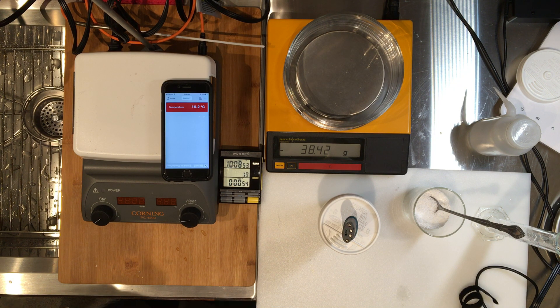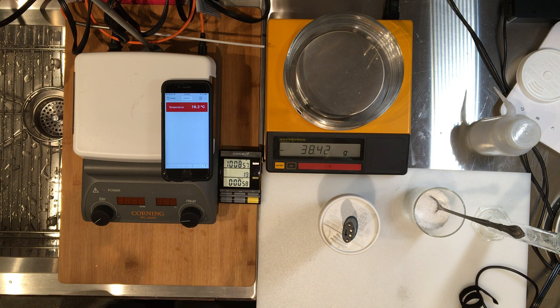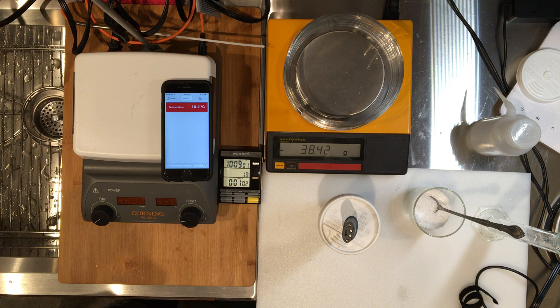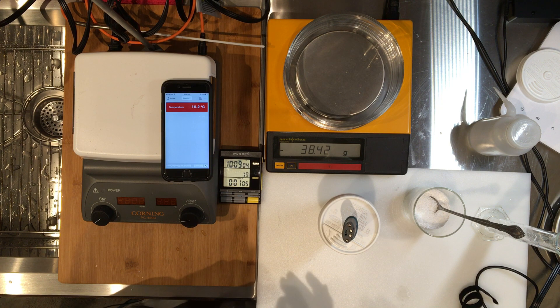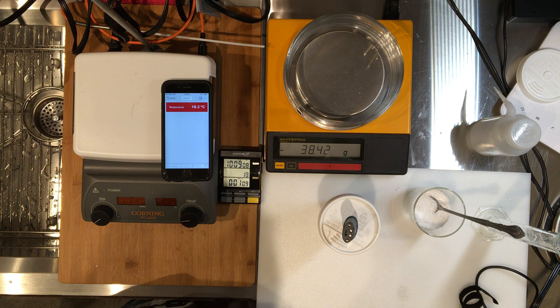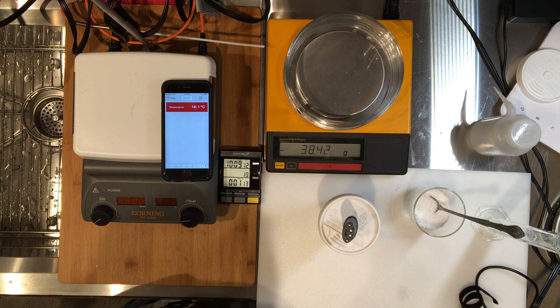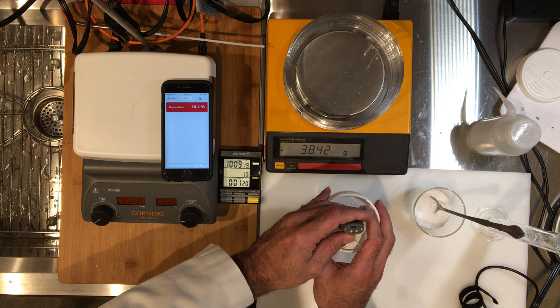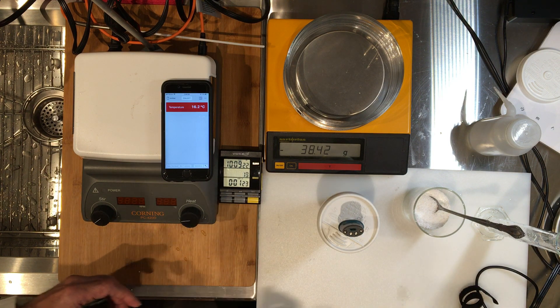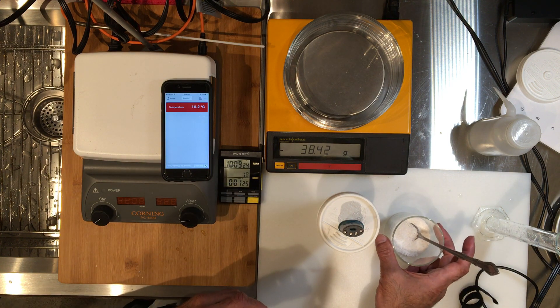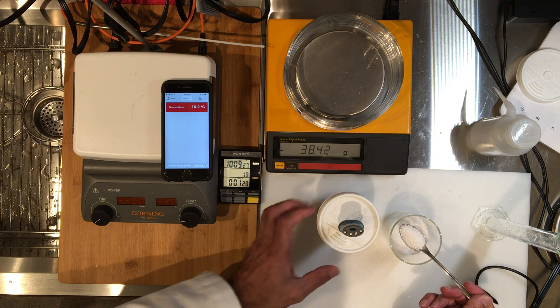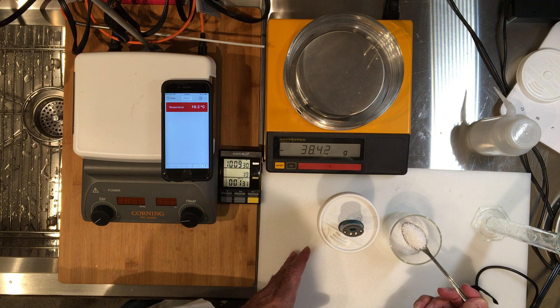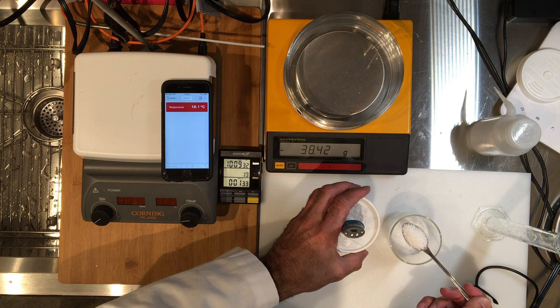We'll stop after like maybe one minute 15 seconds or 30 seconds. So let's keep going until one minute 30 seconds. You have enough data for the baseline now. Okay, at this point this is your last measurement.